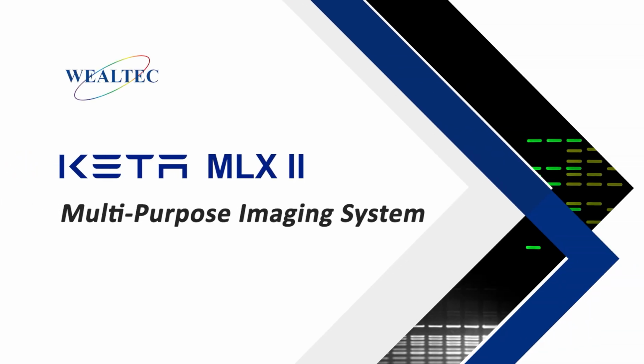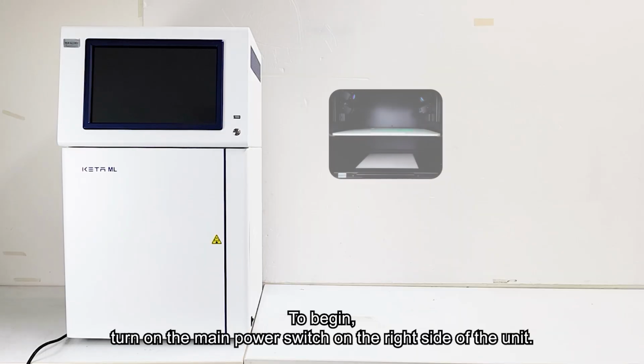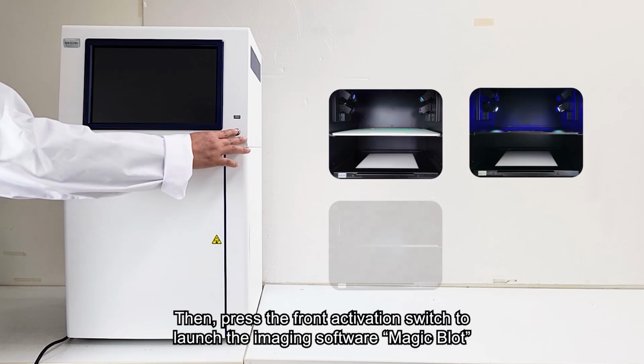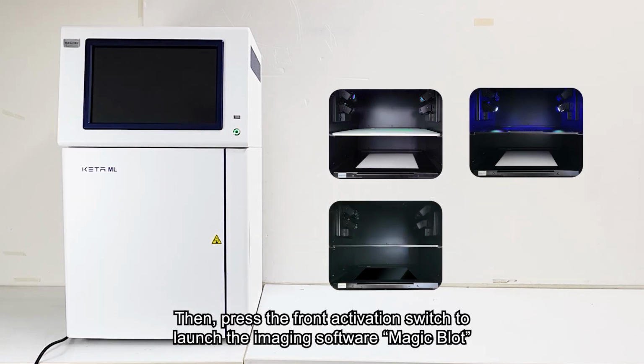KETA MLX2 Imaging System. Operating Features Overview. To begin, turn on the main power switch on the right side of the unit. Then, press the front activation switch to launch the imaging software, Magic Blot.